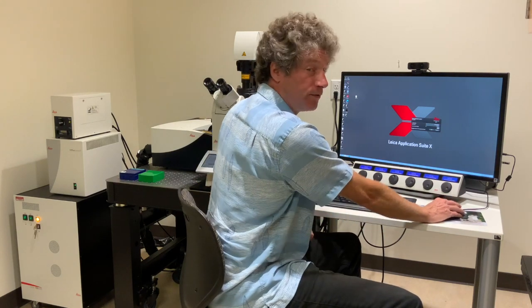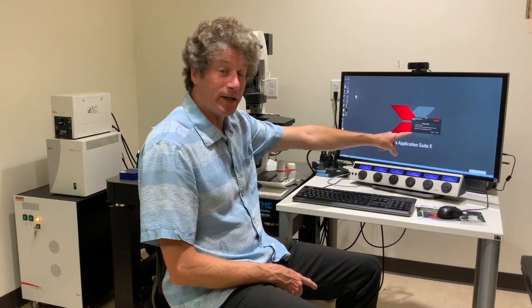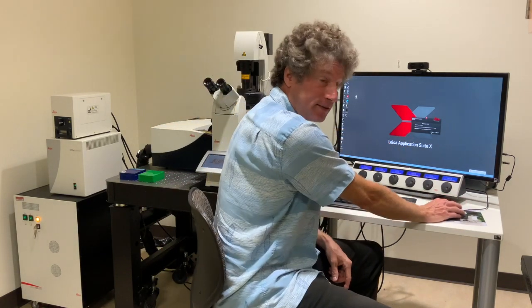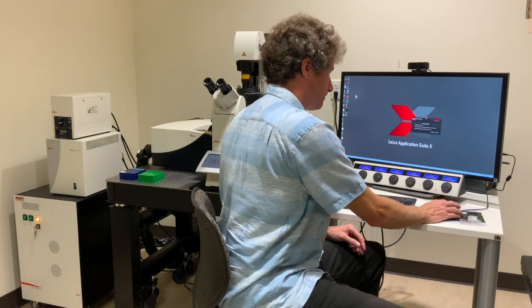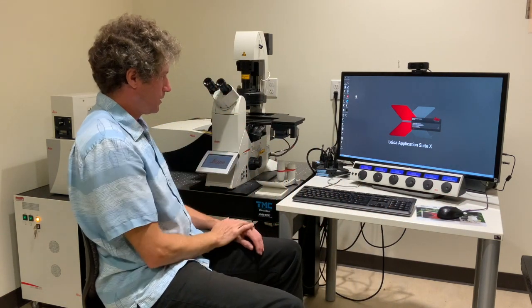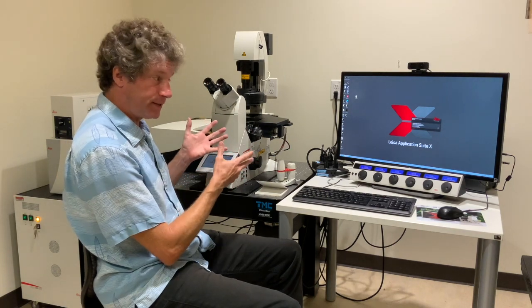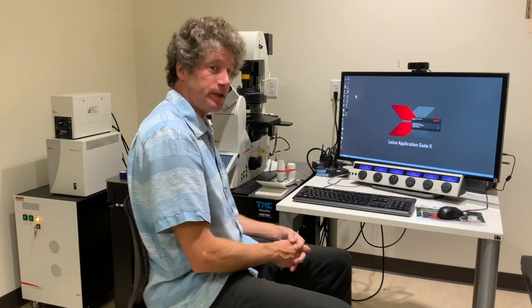You leave the configuration and click yes. Here's the microscope stand — you click yes. Then it says initialize stage. Be careful, make sure nothing's in the way, and click yes. You'll see it moving, so you've got to leave it alone. Let it do its thing, let it calibrate. Then the software starts up and you're ready to go.